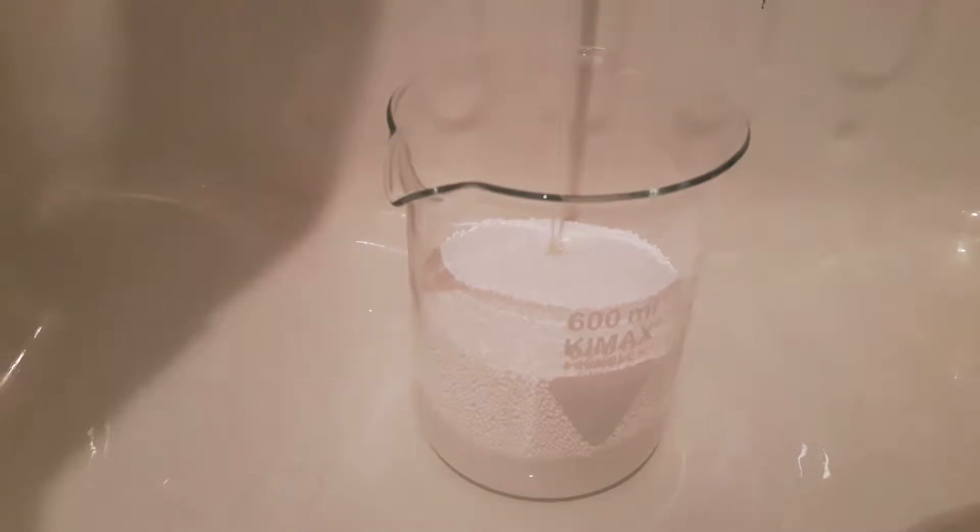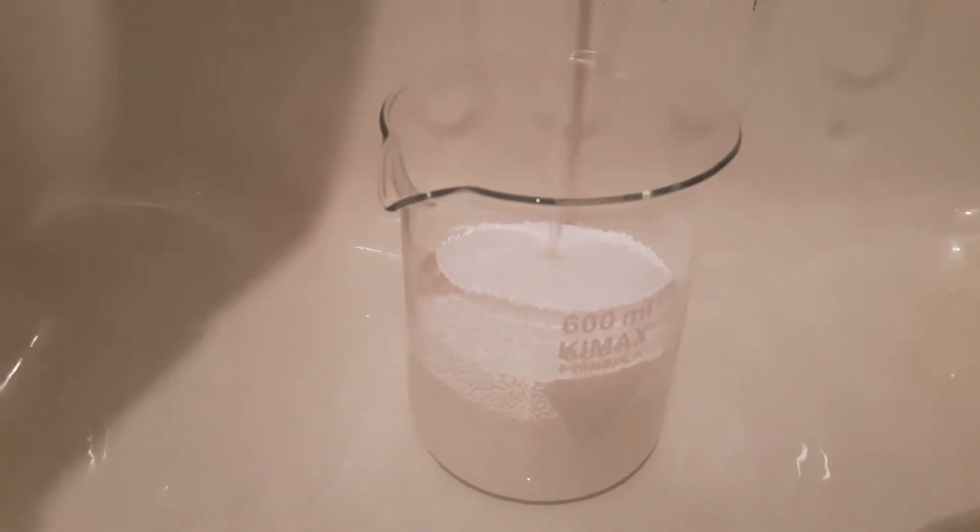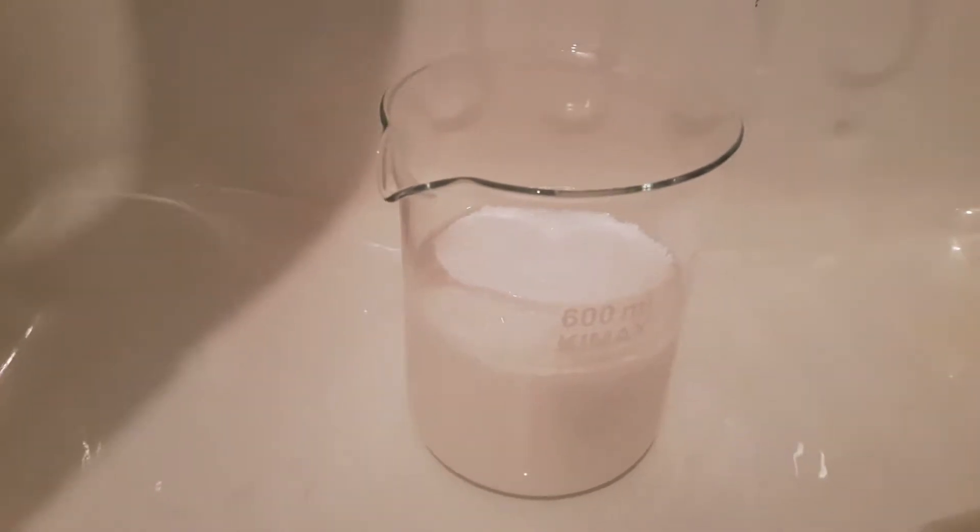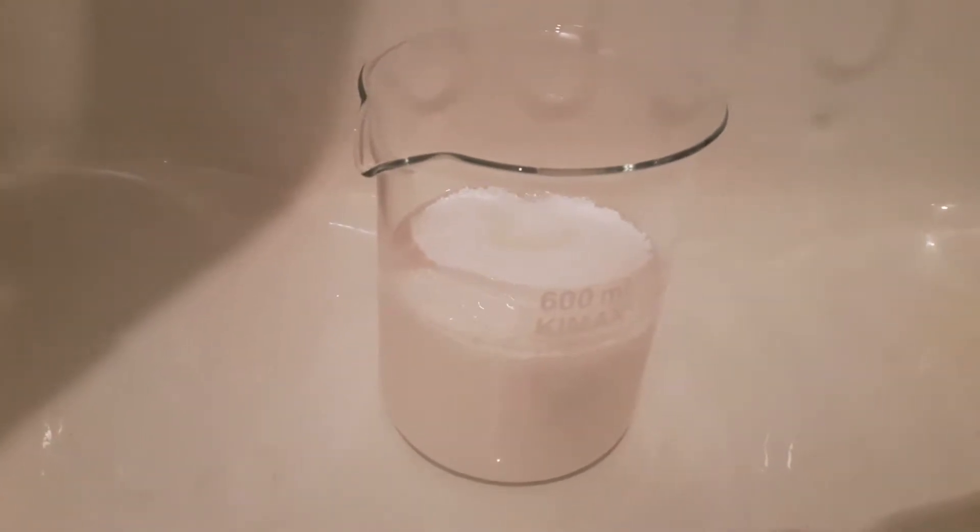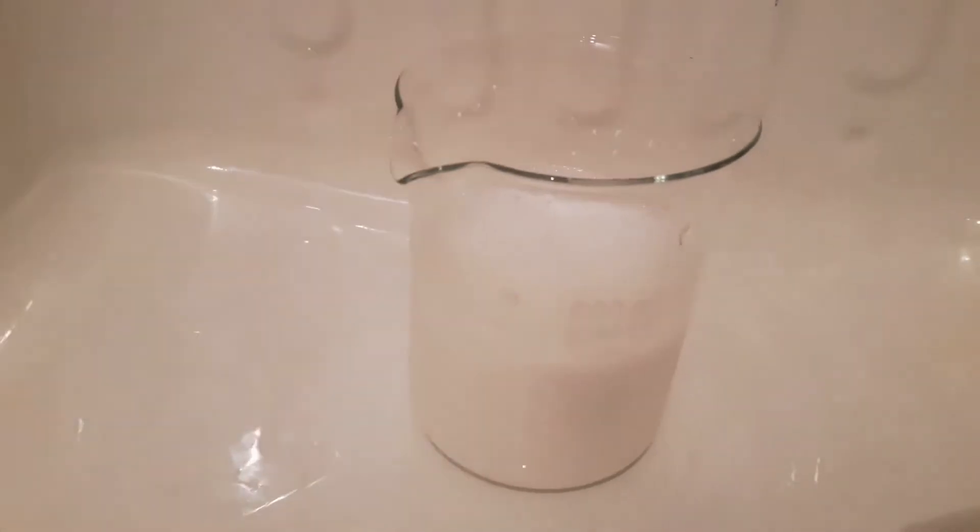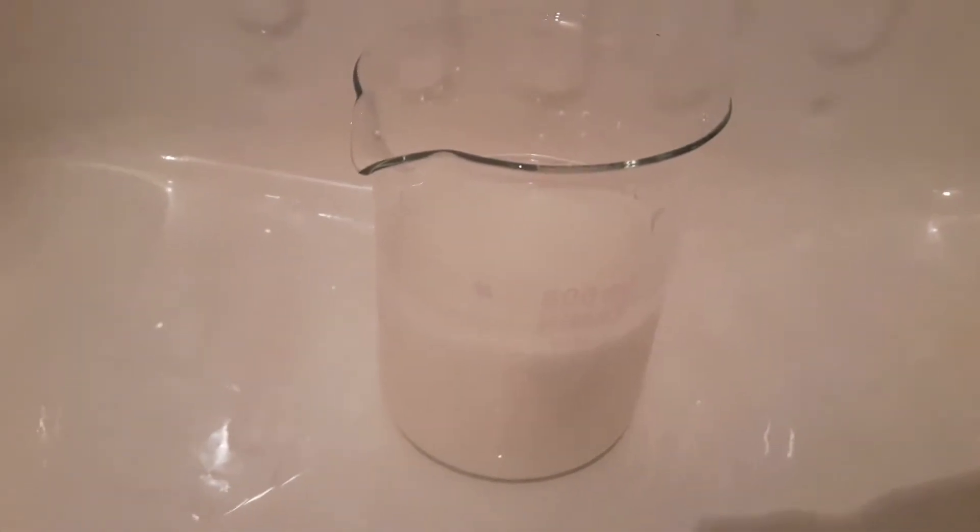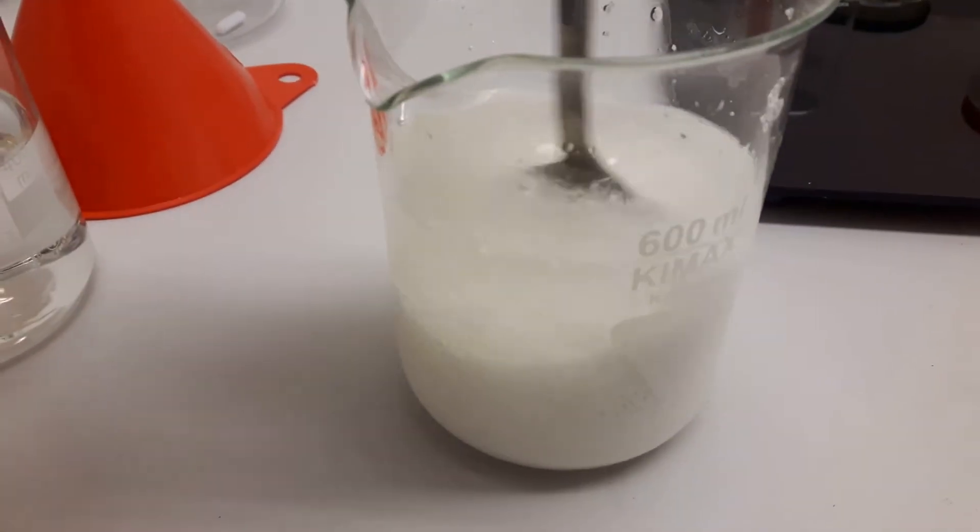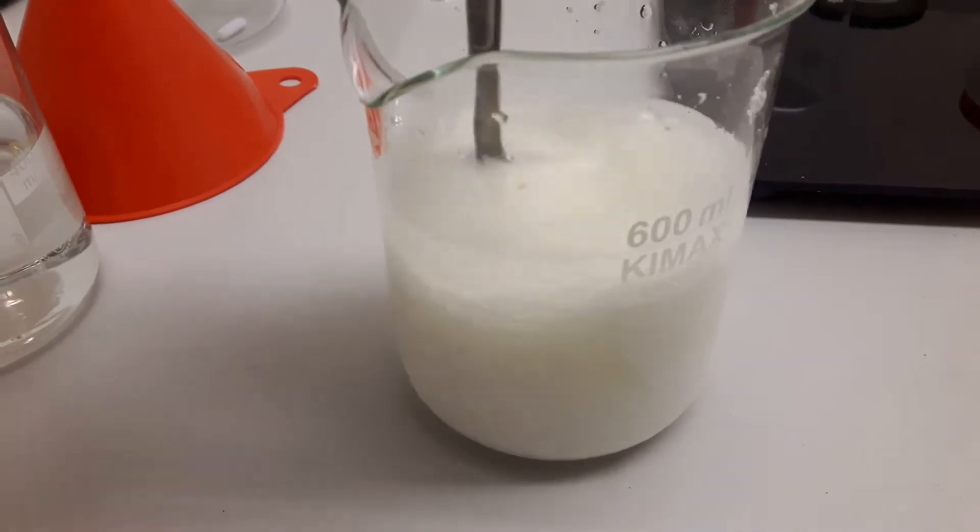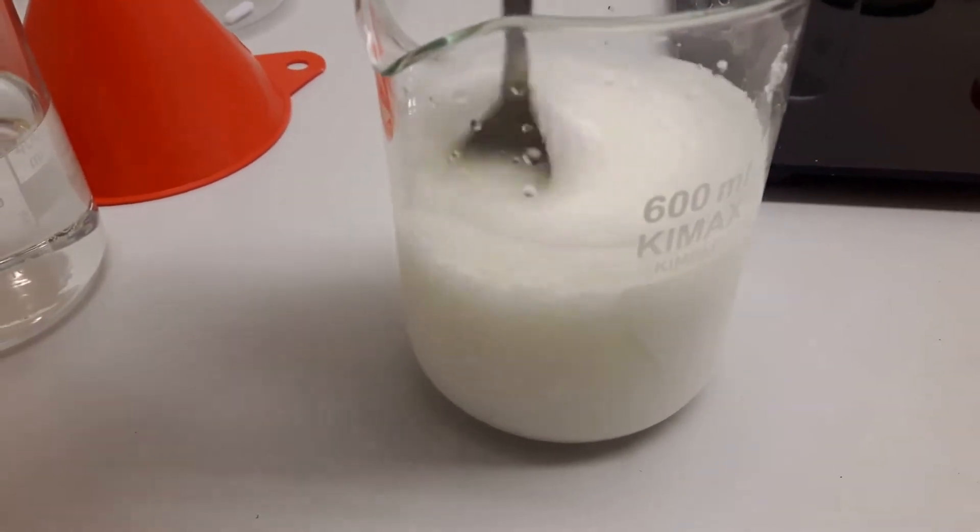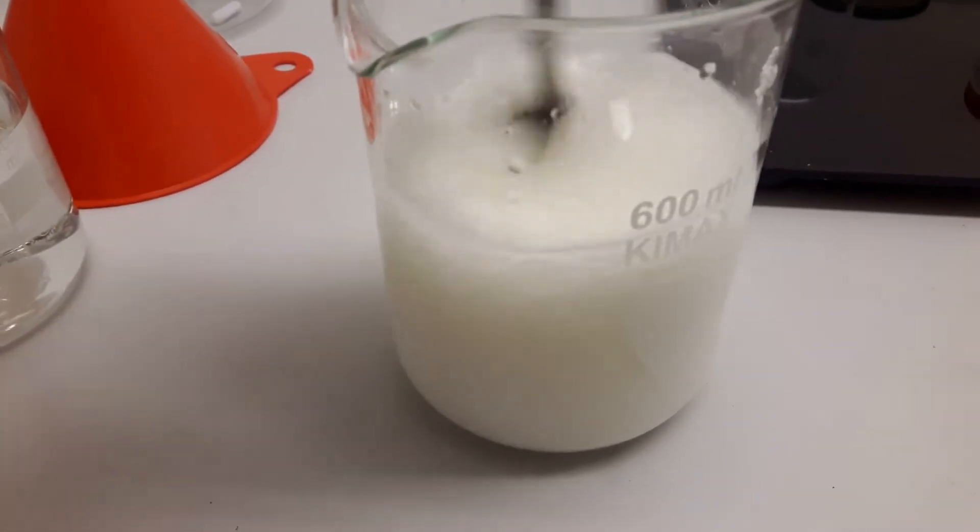The first step is dissolving it in water. I'm filling this up with warm water. I'm actually cheating a bit here because you just see it being filled to around half, but there is some more water needed to get everything into solution. This is pretty difficult to dissolve even in hot water.